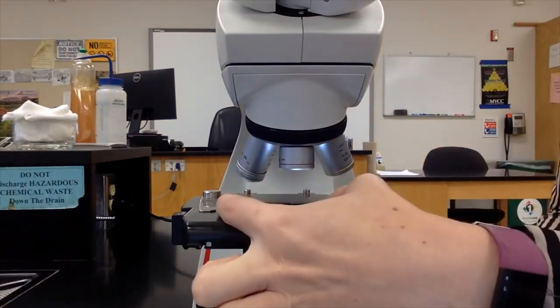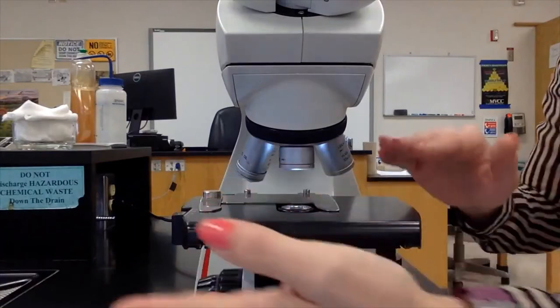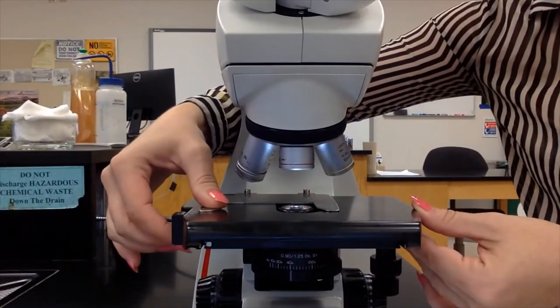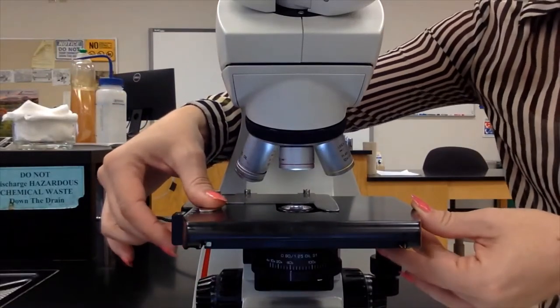After making sure your microscope is set on the scanning objective lens, you insert your slide gently by sliding it in between the arms of the slide holder.